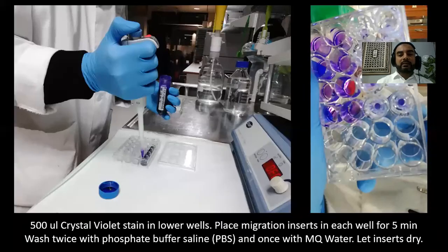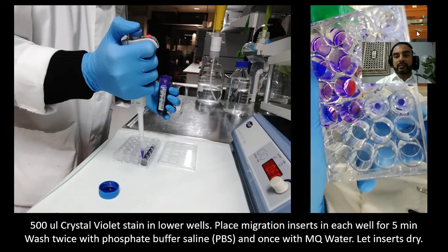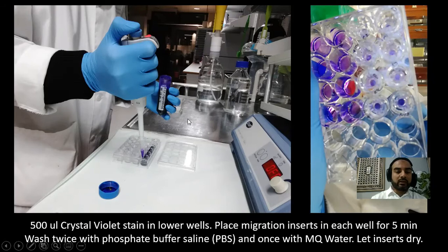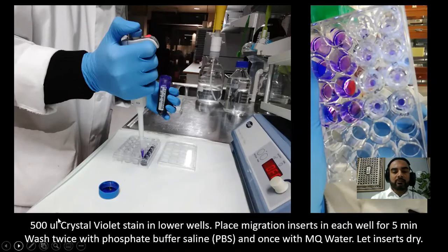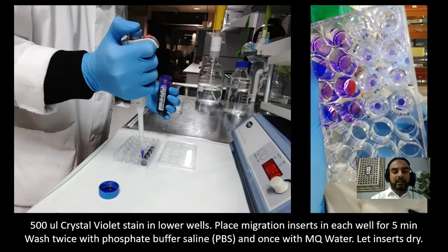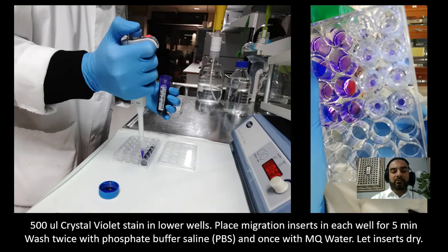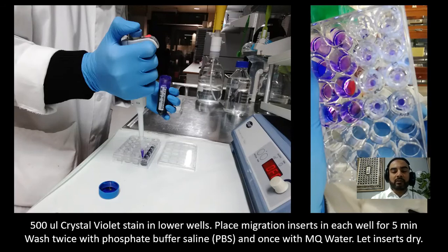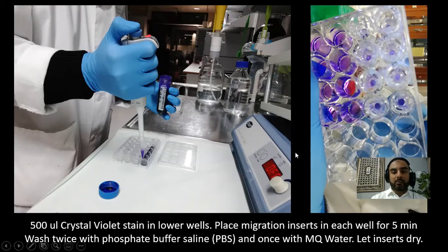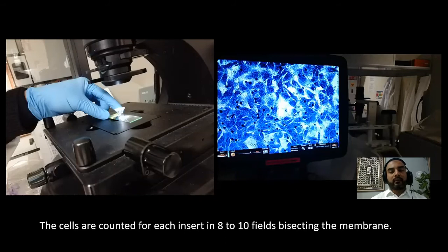The next step is to stain the cells. On the right-hand side you can see a finished example showing stained cells. We use 500 microliters of crystal violet stain in the lower wells, then place the insert on top so the bottom of the membrane is stained — for five minutes. Then we wash each insert twice with PBS (phosphate buffered saline) and once with MilliQ water to remove phosphate crystals, and let the inserts dry for a couple of hours.